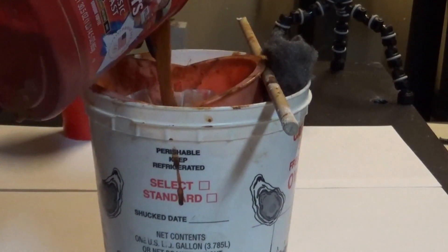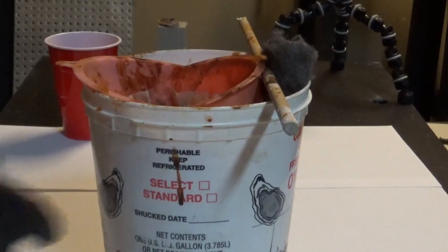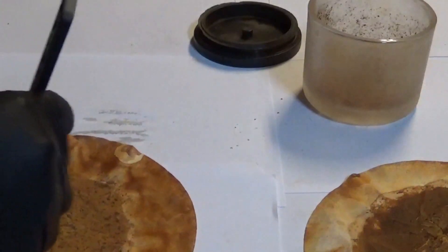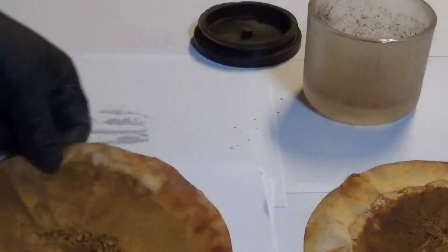It's going to take a little while because all the rust in there is going to clog it up. I'll set the jar over to the side and let that drain. For the purpose of this video I already have a couple of other filters that I've already strained. There are the coffee filters — I'm going to scrape all the rust off of them and put it into that glass jar over there.